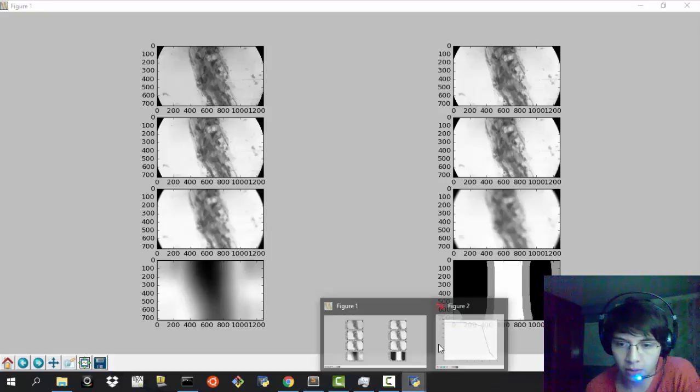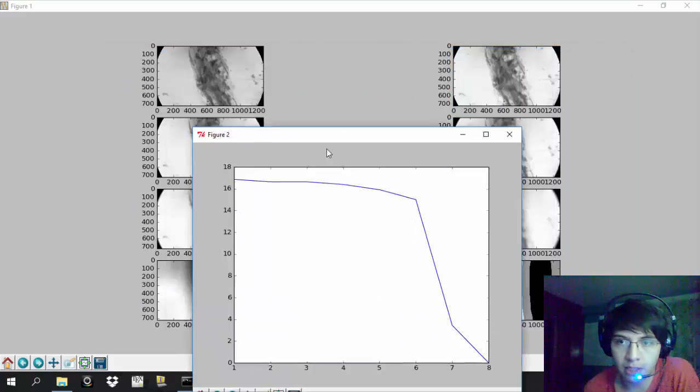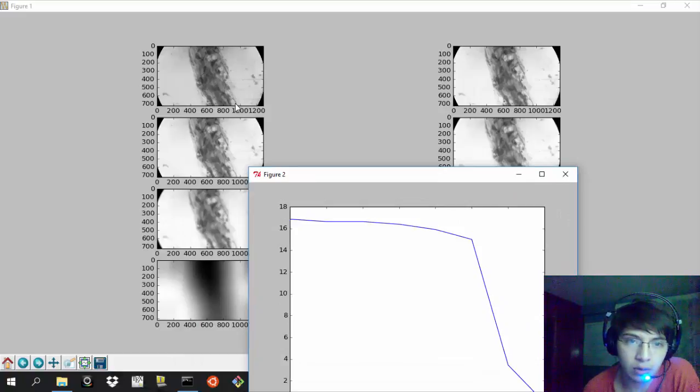Besides that, the curve that I'm going to show you fits well with what I was telling you. This is the frame that is in focus, and as you can see, it has a value of more or less 16.70781, and the next one has a value that is smaller, but not that much. From the experience that I have had, the classifier is going to work even if we use this image or this image. These two are acceptable. Even this one is acceptable, because anyway we're going to use a low pass filter to eliminate high frequencies and make the color detection algorithm or the machine learning algorithm more reliable, so that we don't have that much variance in the image.